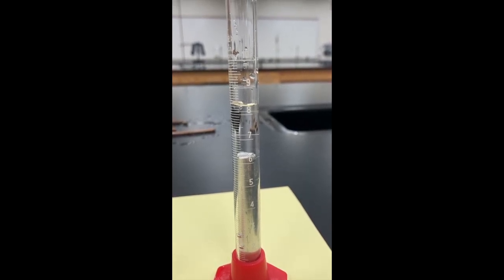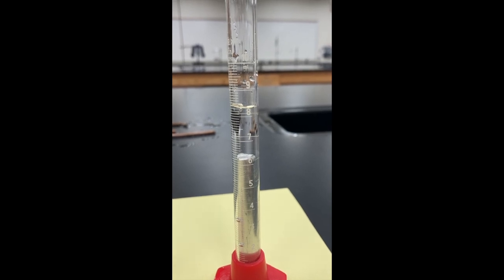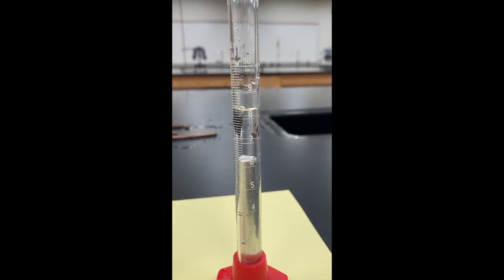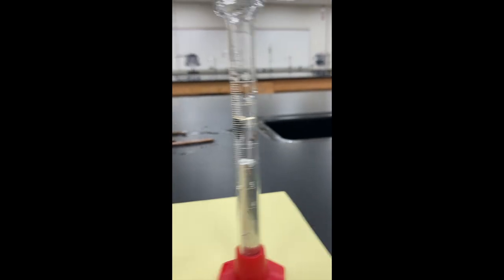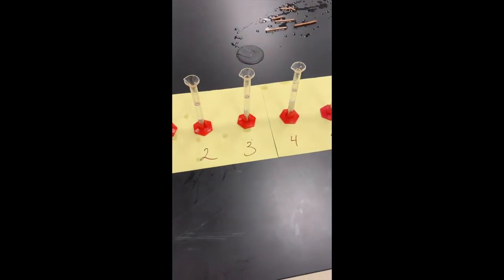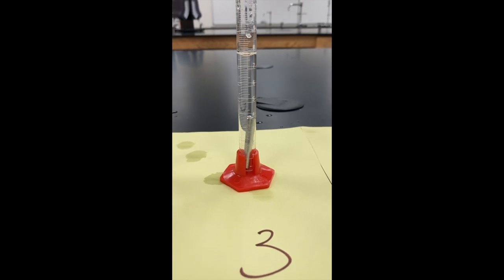If you have difficulty reading any of them, just make your best guess. All right, those are all of our volumes for our aluminum pieces. There's something interesting about piece number three that I want you to see.